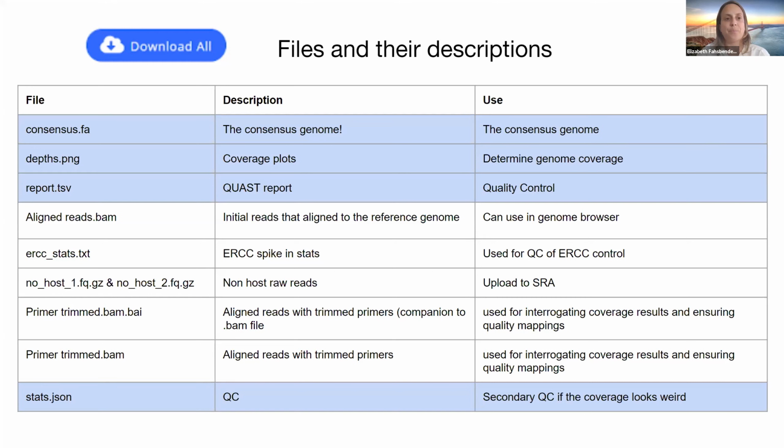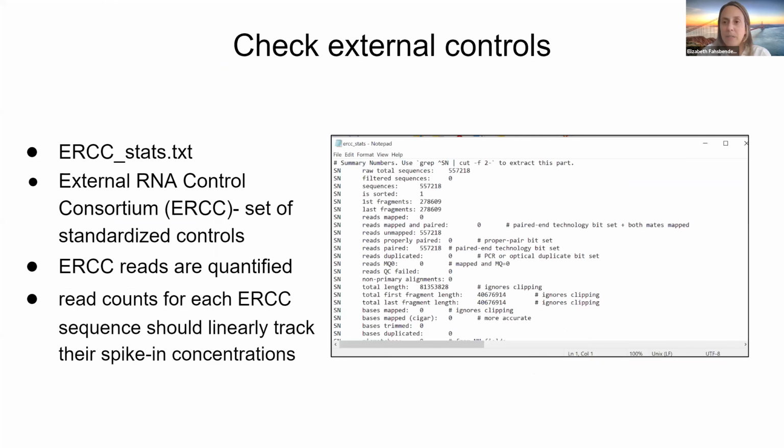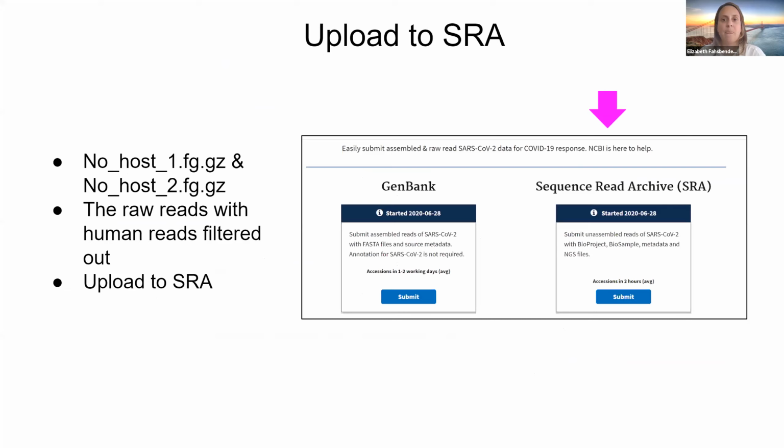So you can interrogate these files if you'd like, but I'm going to go over the ones that are not highlighted. So if you happen to spike in with ERCC controls, you can look at the ERCC stats text file, and you can see the number of reads that are quantified here. And then we have these no host, so again, no human reads files that are really useful if you want to upload this to the Sequence Read Archive on NCBI.